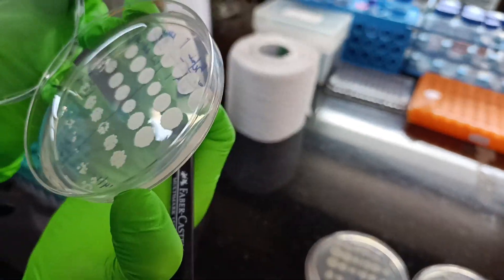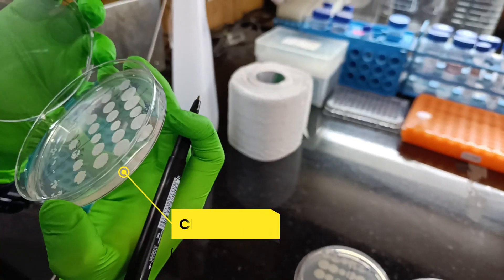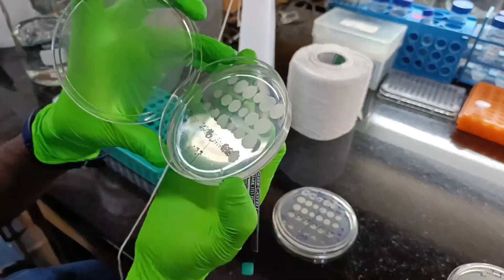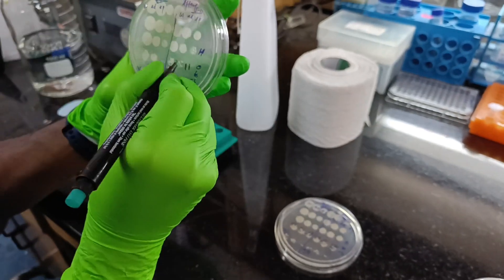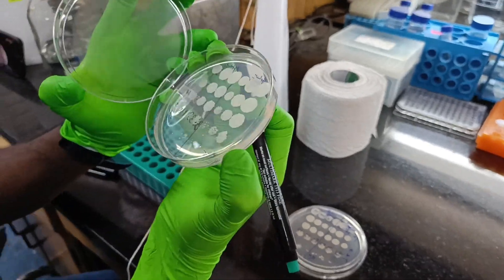Now it is time to do some CFU counting — colony forming unit counting of my spot plates which have been in the incubator for the last 3 days after performing some serial spot dilutions.